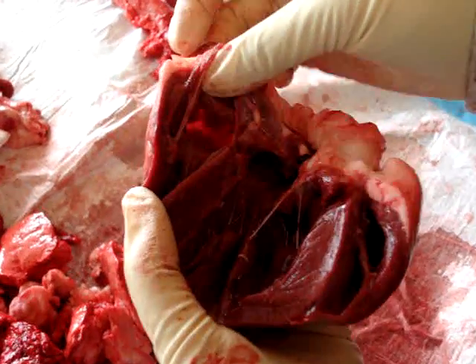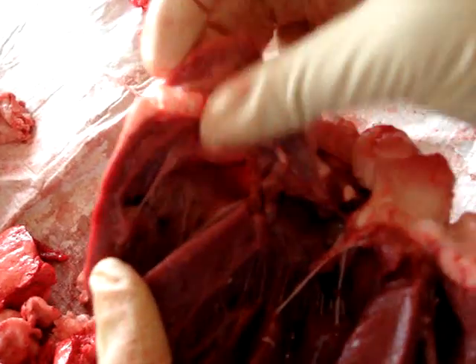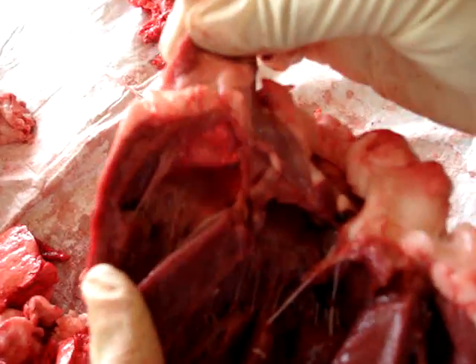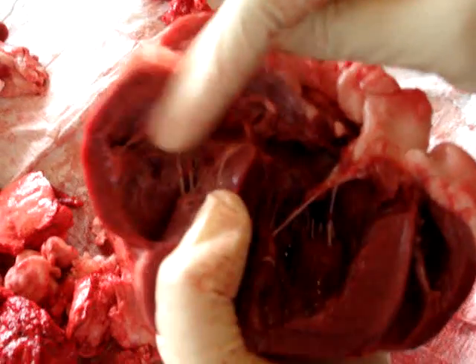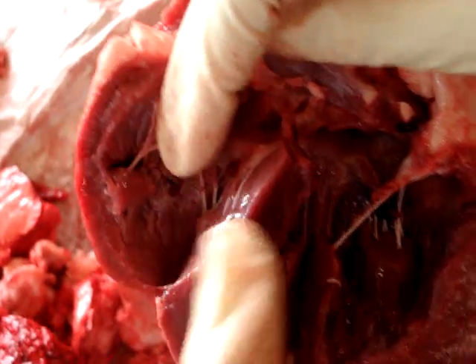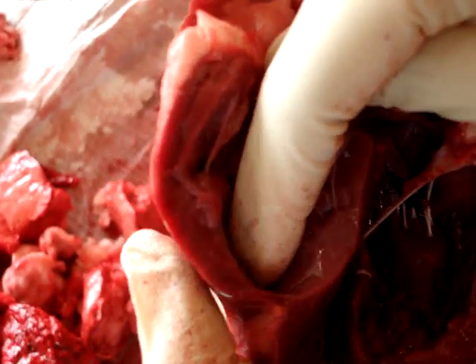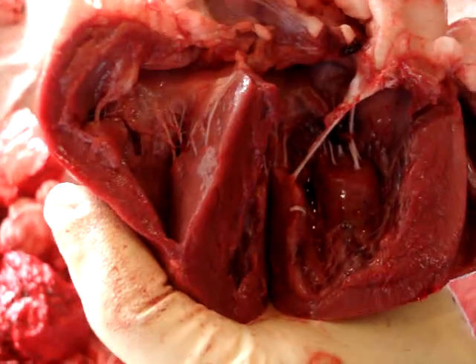This is the right atrium and you can see the pectinate muscles and the auricle. This should be the tricuspid valve with chordae tendineae, and it goes into your right ventricle.